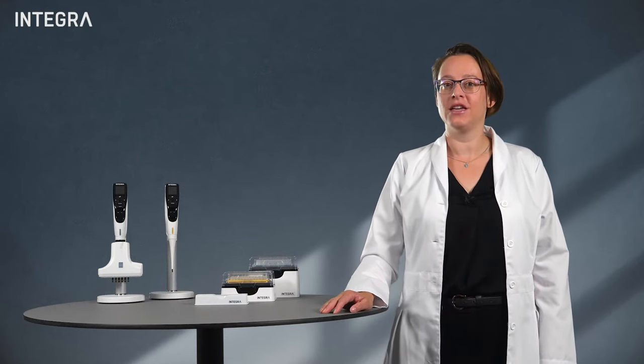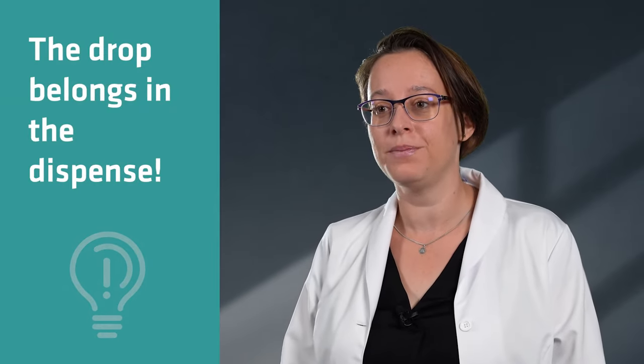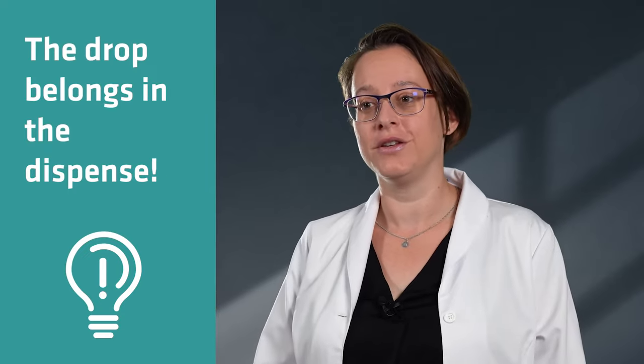After dispensing, you'll often see a drop at the end of your tip. What you might not have known is that this drop belongs in the dispense and not on the tip. There are three main ways to do this.